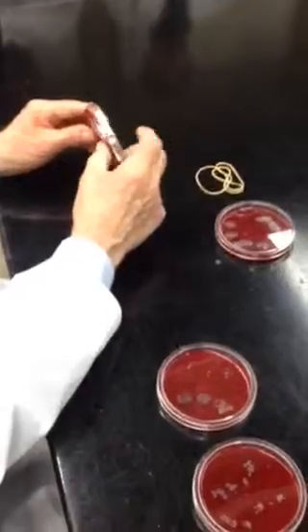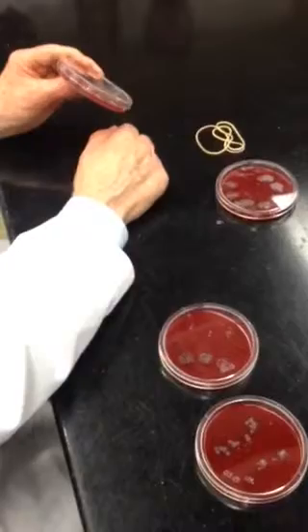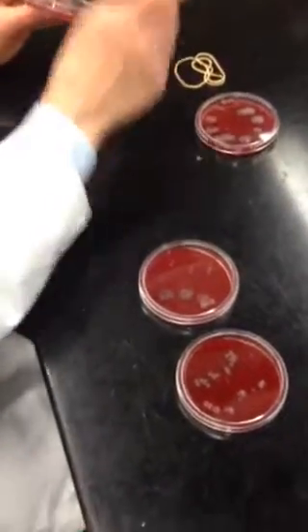Is that drying your hand? This is with your hands dry. And this is after you wet them. Even more growth after you wet them. Right? We'll explain why in a minute.